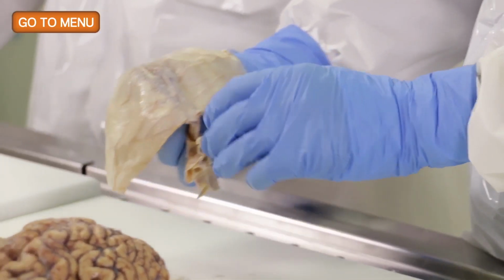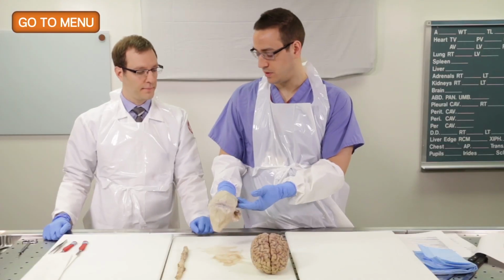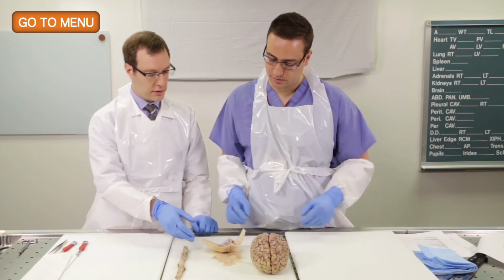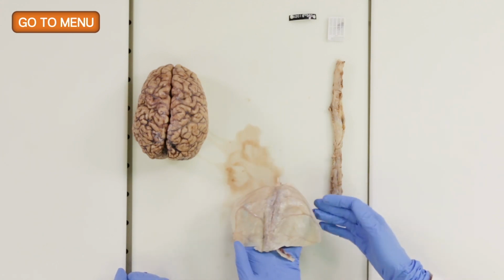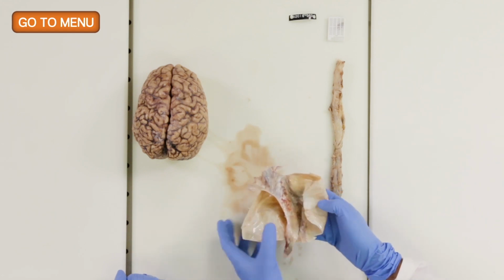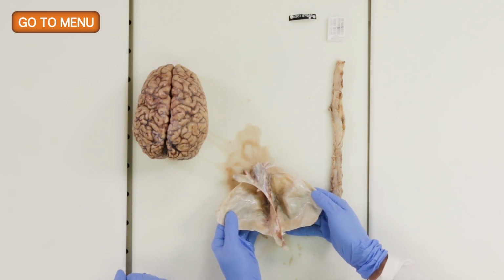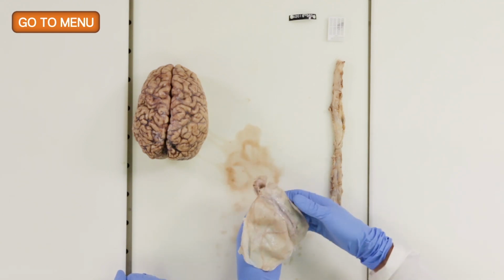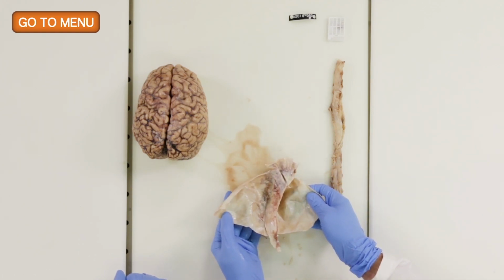And besides masses, what type of lesions are frequently associated with the dura? You could also look for hemorrhages. That's right. If the patient had a bleed, and I don't see any evidence of bleeding here. Right. So you want to take a look at the color of the dura to see if there's any evidence of prior hemorrhage. So this is the superior aspect of the dura. You want to look for epidural hemorrhages. On the other side, you want to look for subdural hemorrhages. And if it's a remote hemorrhage, you might only see a fibrous membrane associated with the subdural aspect. So in this case, the dura looks unremarkable in terms of its coloration. So we'll make a note of that.